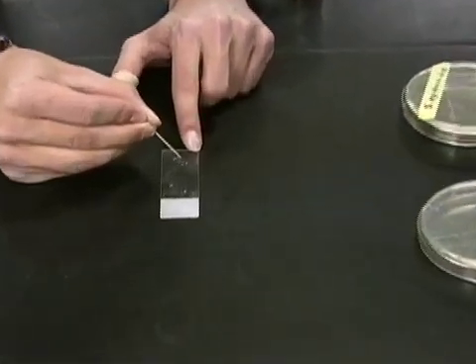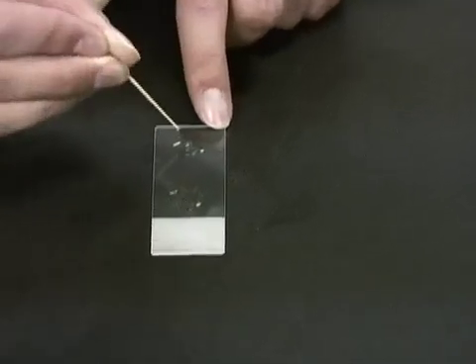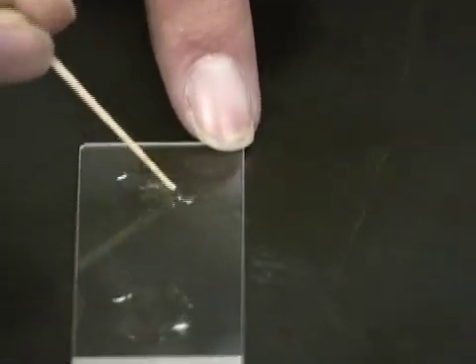If bubbles appear, the organism is catalase positive. We will show this up closer in a second to get a better view.